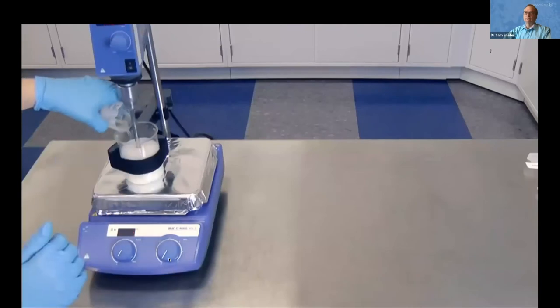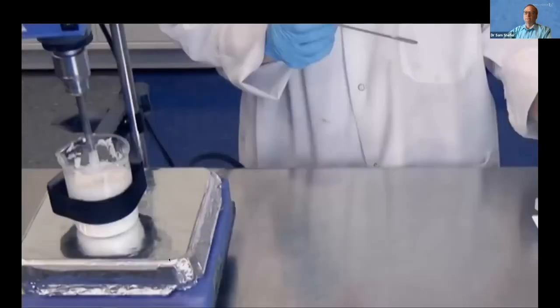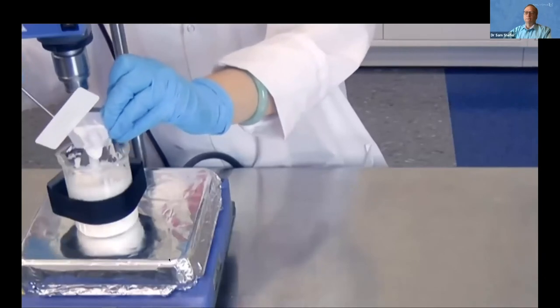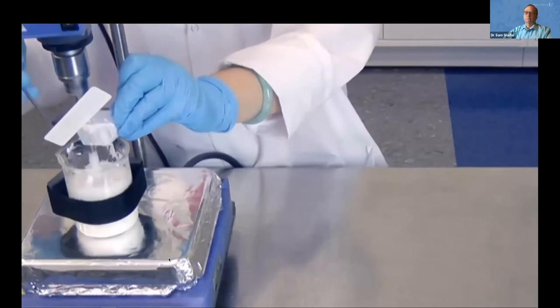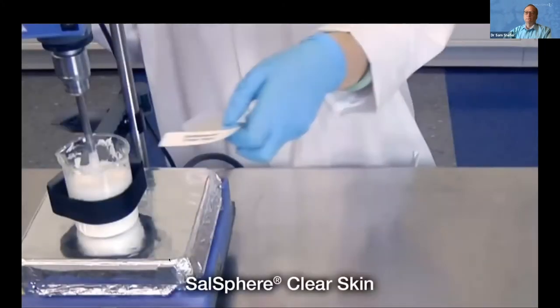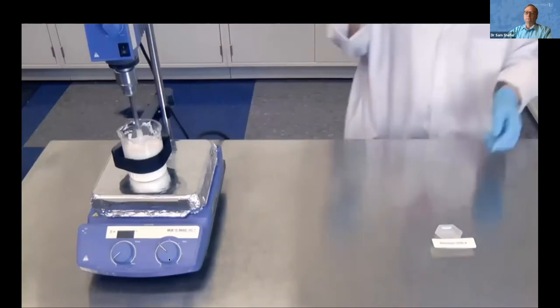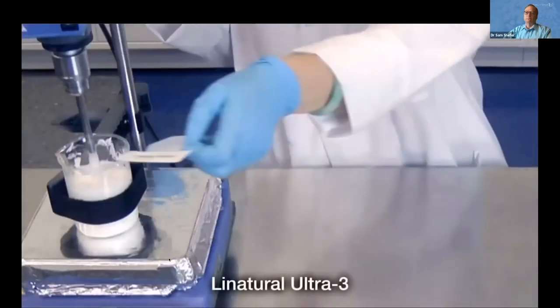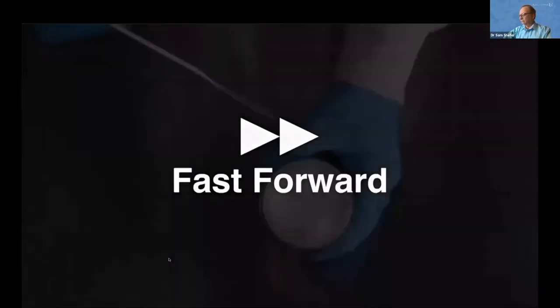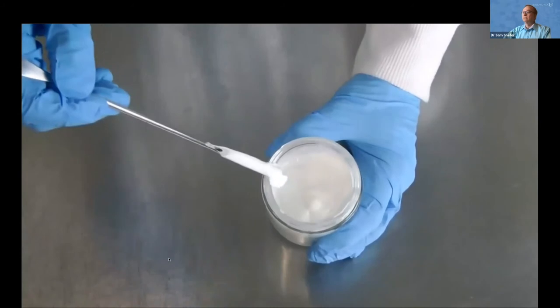As you add the oil it will thicken the water phase considerably, so increasing the propeller speed may be necessary. Now that our lotion has cooled to room temperature we add actives and preservatives. Our first active is Salsphere Resveratrol — our encapsulated resveratrol — which goes in with ease on top of the final formulation. Next we add Salsphere Clear Skin, which provides brightening and exfoliating power. Lastly we add the preservative, LA Natural Ultra 3. We mix until homogeneous and we have finished our lotion. The result is a nice white emulsion — not too thin but also not too thick.